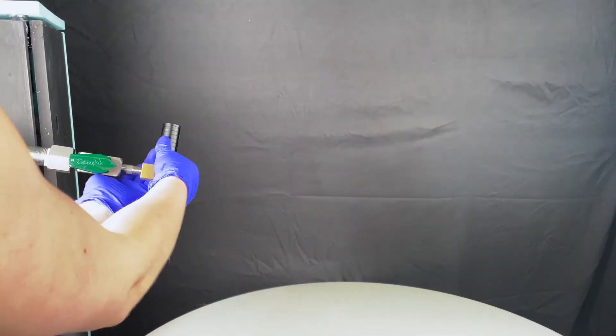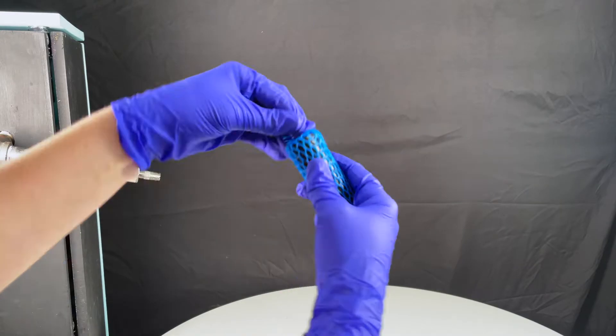If you rented your AirCheck kit you can return it to Trace Analytics. It will be cleaned and prepped for its next use.